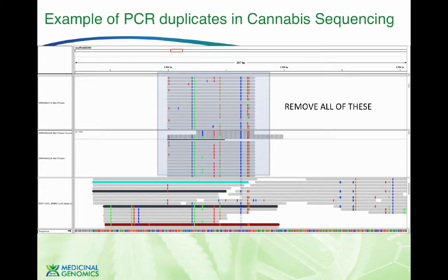Second issue that's going on with this data is they're using incredibly short reads. In fact, this standard is probably 10 years old. These are 75 base pair reads, and they're only unidirectional. You'll see they're all going one direction here. So they're taking a PCR product, a short one, 100 base pair PCR product, and they're cloning it. And when I say cloning it, they're adding primers on the ends of that DNA that match the Illumina sequencer. When you do that, the DNA molecule can glue in the forward orientation or the reverse orientation. So you get both directionalities out of the molecule, but your reads are only coming off the forward primer.